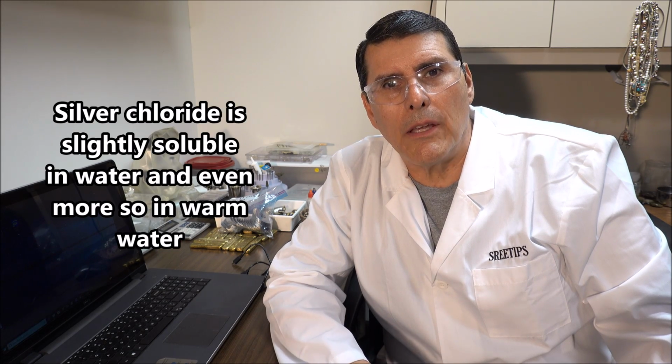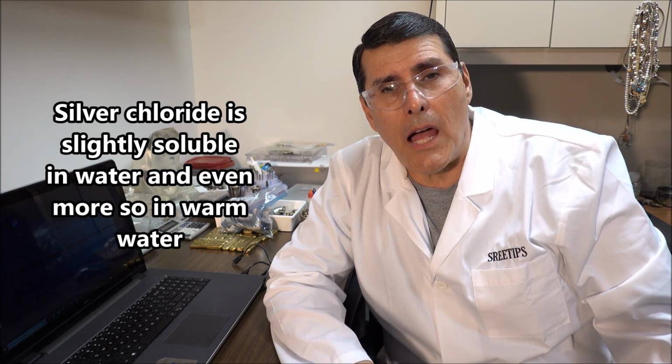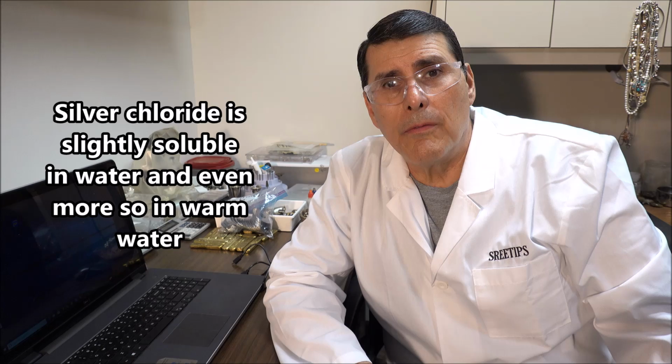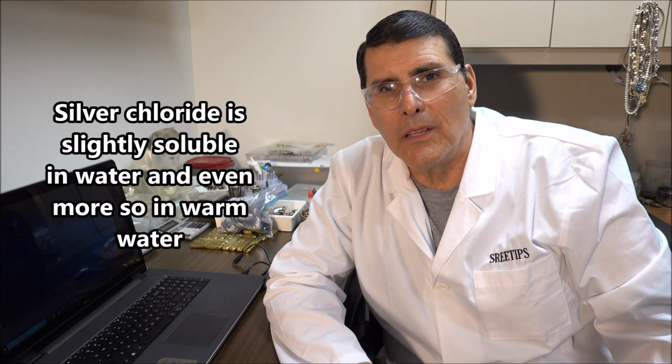And what they'll do is they'll hide out in the solution. The solution will look clear and bright, but it will have silver chloride in it, dissolved. And the only way to get it out is to chill it down and filter it out. Also, silver chloride is a very fine material that will pass right through a filter paper. So what we're going to do right now is show how to process the gold that's been over inquarted with silver. We'll do that right now.